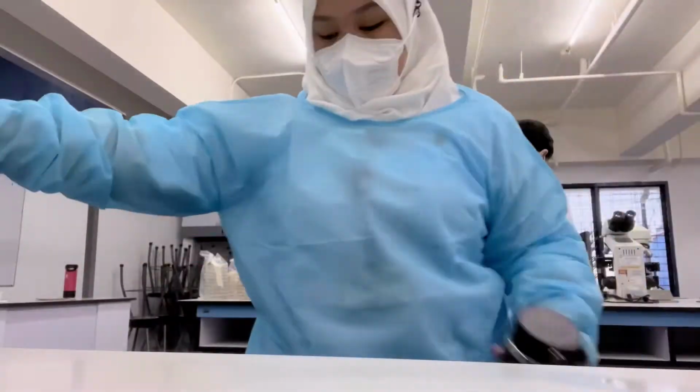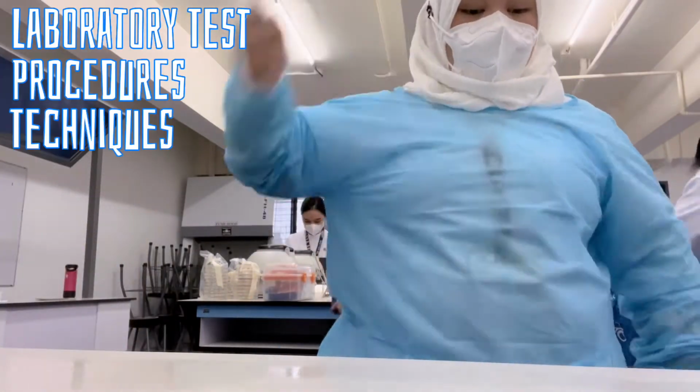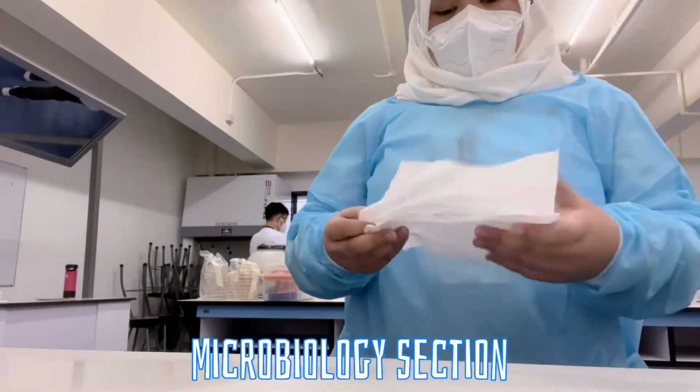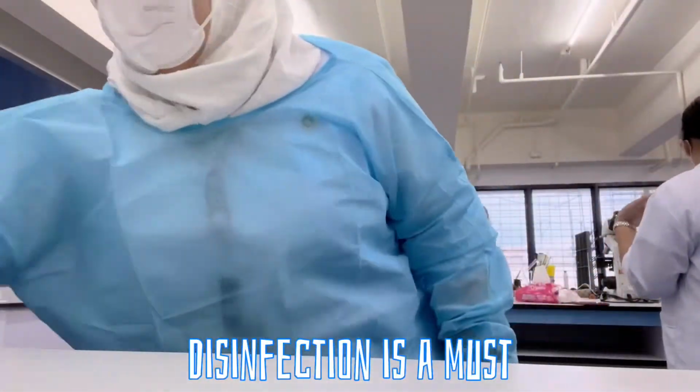In this video, I will be showing you different laboratory tests, procedures, and techniques that are done under the microbiology section of the laboratory. But before anything else, disinfection is a must.